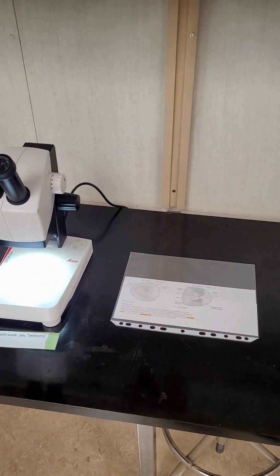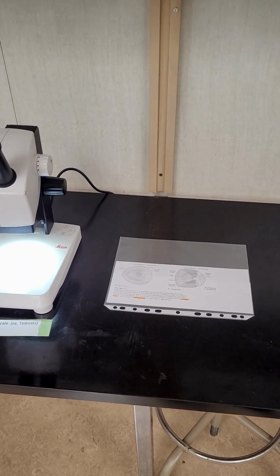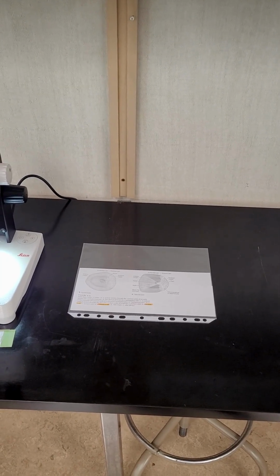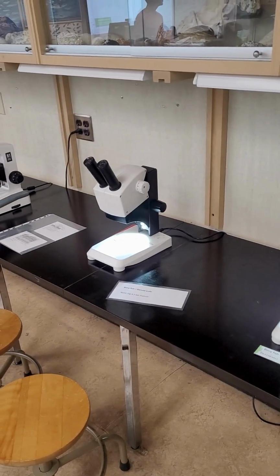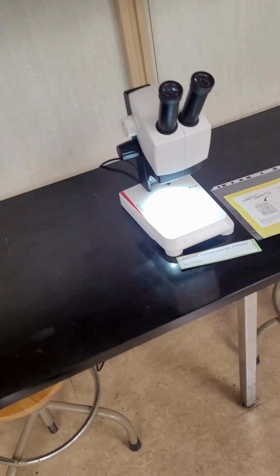And before we go to a super light scale in the cycloid and ctenoid scales of the derived fishes, the bony ray-finned fishes, particularly teleosts. And this one is actually composed really of a very fine bone layer with a sort of cross network of connective tissue and a very fine enamel layer. So we've seen a trend from dermal armor to the super light scales, allowing much greater mobility, flexibility, and lighter as well, because these are going to be less dense, so that's going to aid in buoyancy.